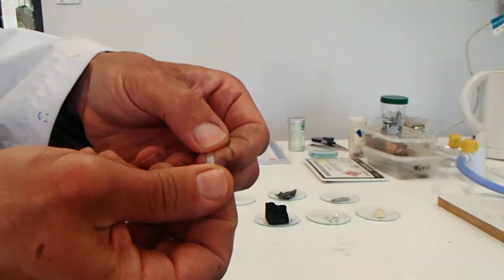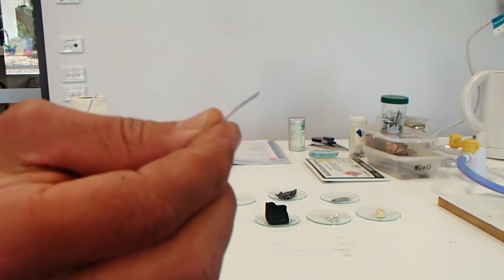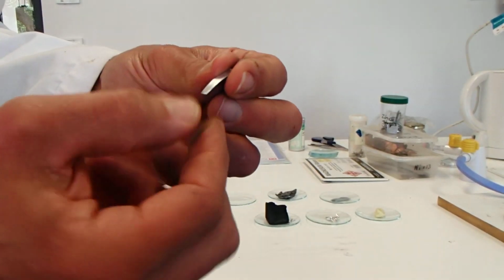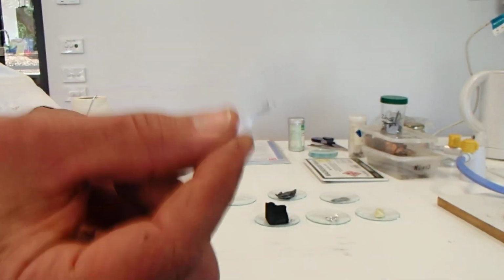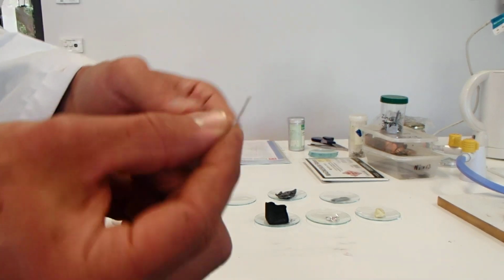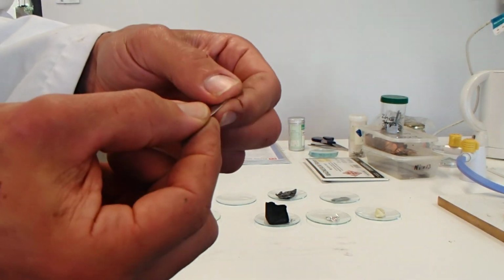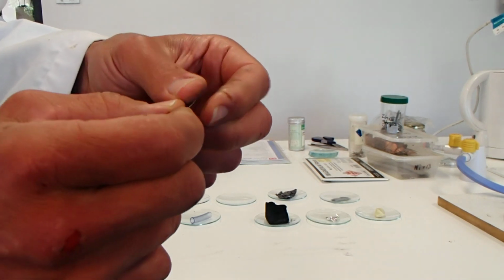Magnesium, fairly shiny, silver colour, again quite light in its weight, looking like a typical metal. So you should be recording these in the appearance part of your table. So magnesium, shiny, silver, not super shiny, not much texture, quite smooth.